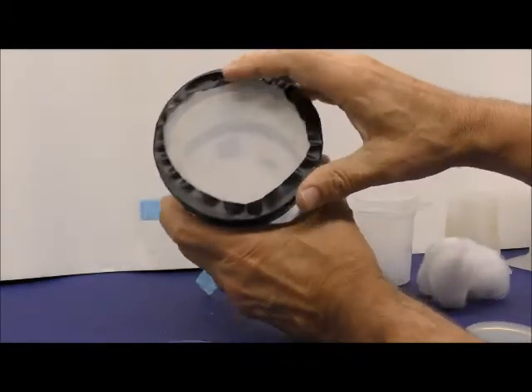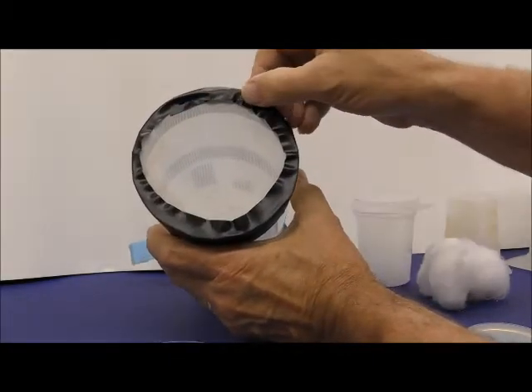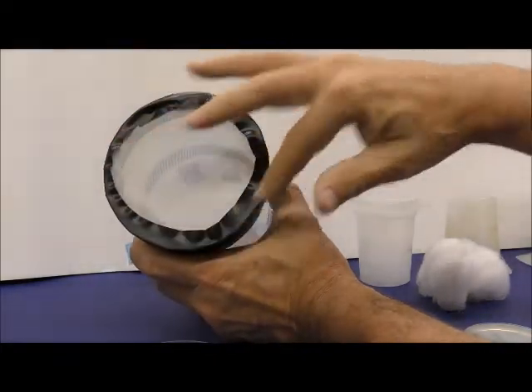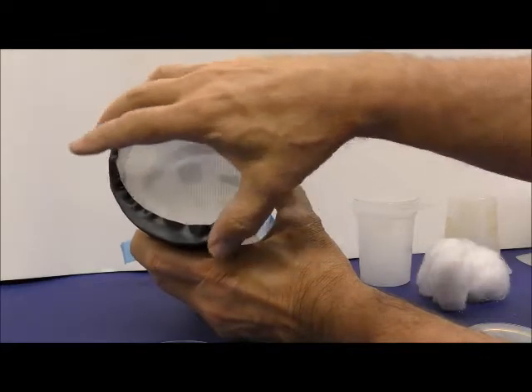The top part of this, I just took some nylon and cut off the edges, put the nylon around, and then just put some black electrical tape around there.